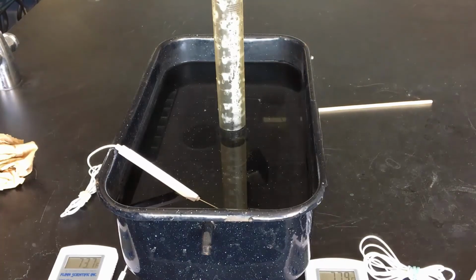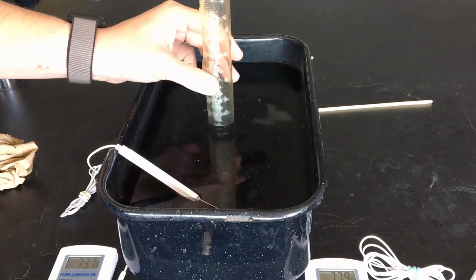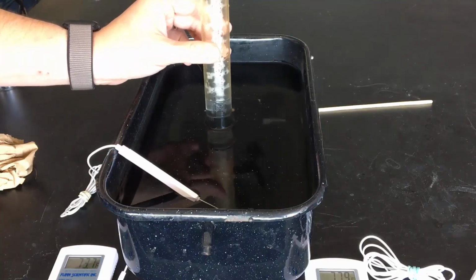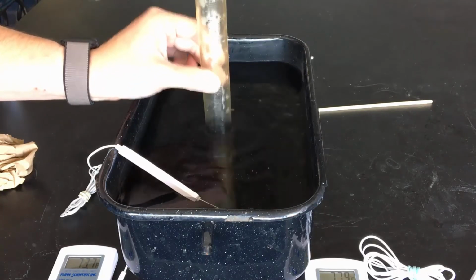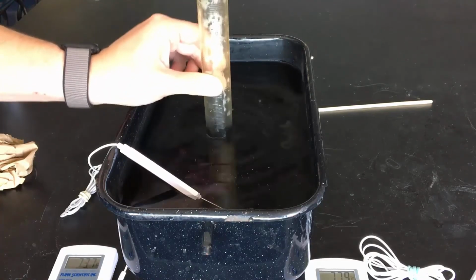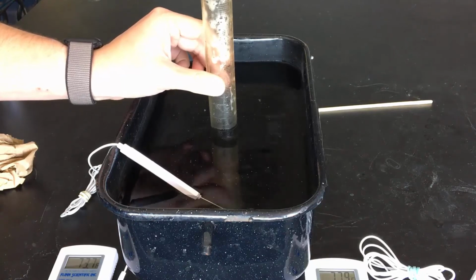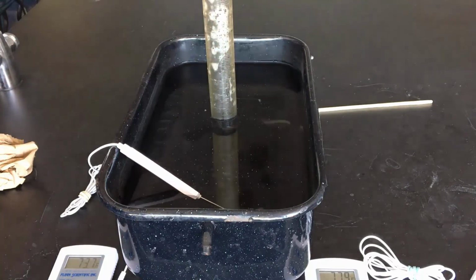Again, this is a rather sloppy lab, just trying to get the idea of the ideal gas law constant being able to be solved by students. We're hoping that we're close, but we also want to realize what could have gone wrong that gave us a number that isn't what all of the scientists tell us that it is. So after waiting about 5 minutes, we'll record the volume then.